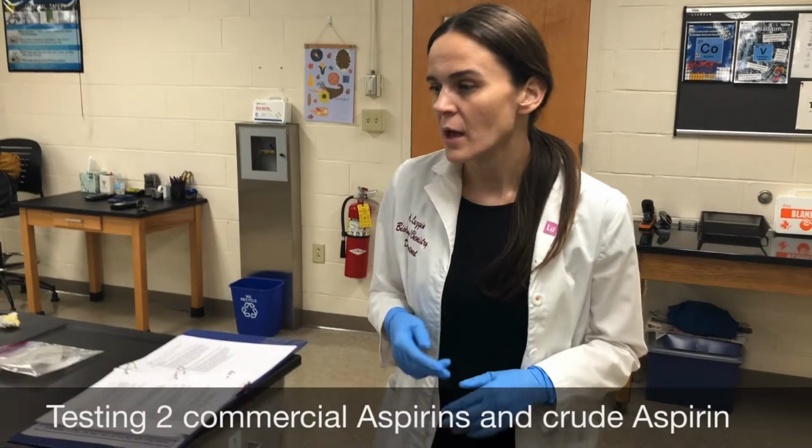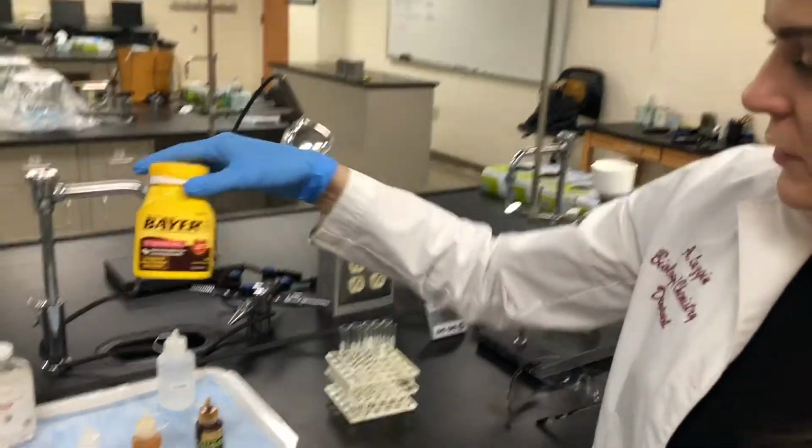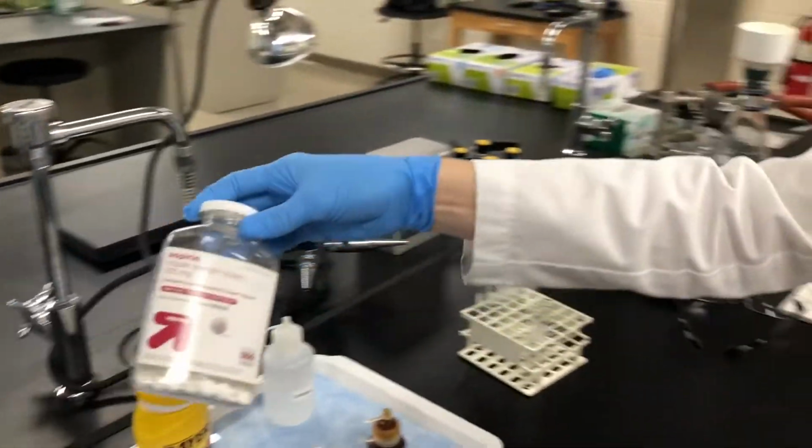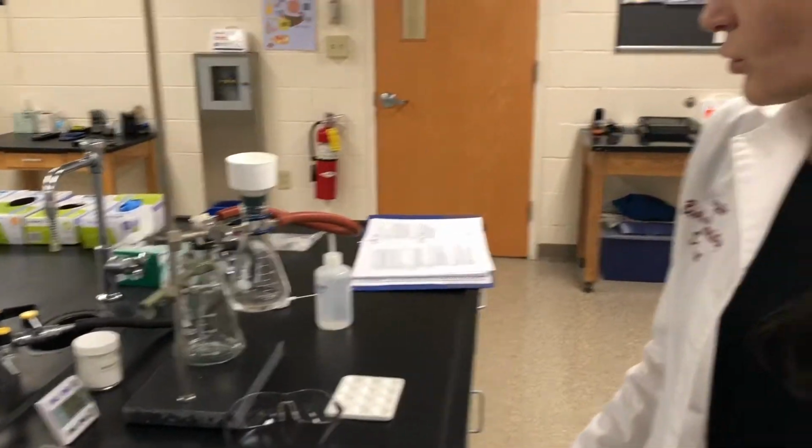So we have a total of 4 tests that we're going to do. The first one is a solubility test. So we're going to see if aspirin is soluble in water. We're going to test 2 commercial brands. The 2 brands are the name brand, which is Bayer, and the generic brand, Up and Up, which we got from Target. And of course, we're also going to test the aspirin that we made.